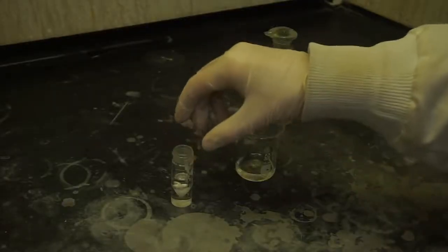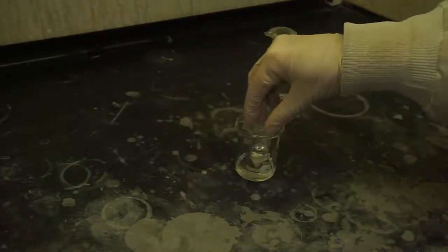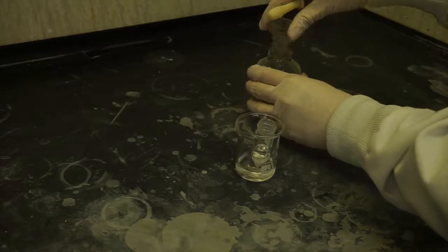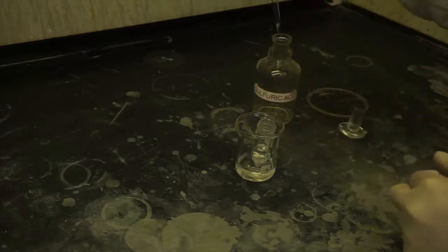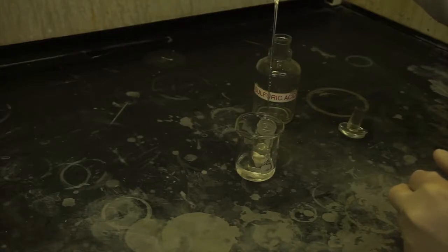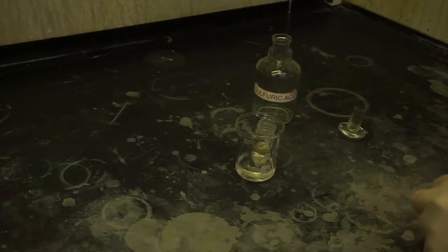Place the conical vial in an ice water bath, and slowly add about 1 milliliter of sulfuric acid into the conical vial without spilling. Instead of using a graduated cylinder, you can just use the marks on the conical vial to measure out 1 milliliter of sulfuric acid roughly.